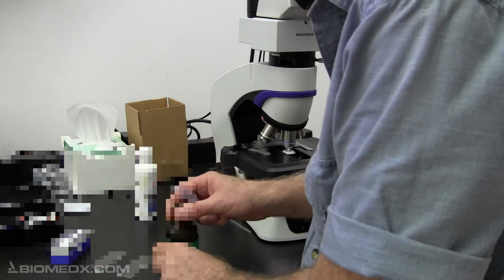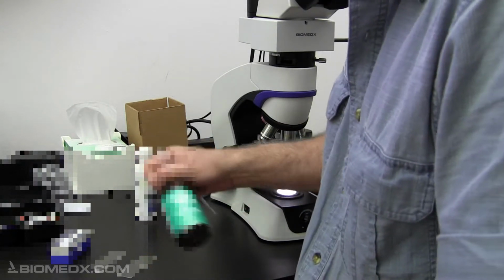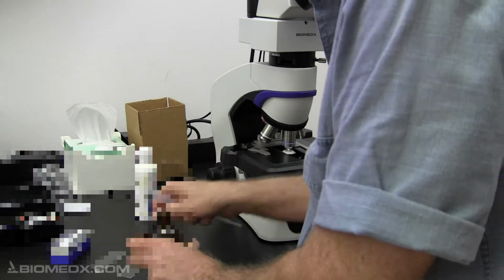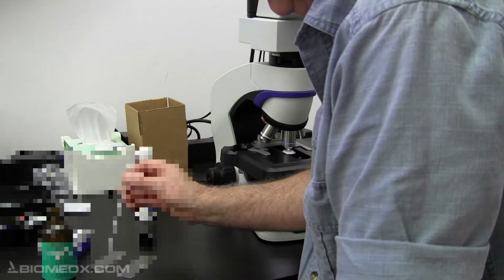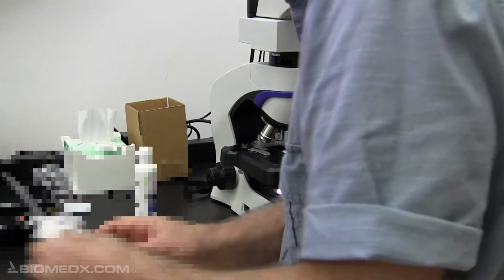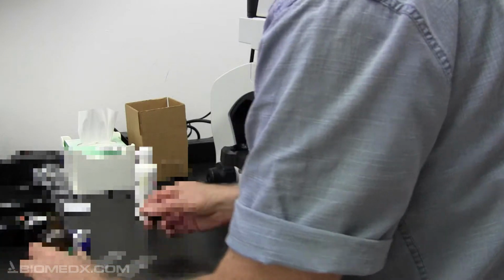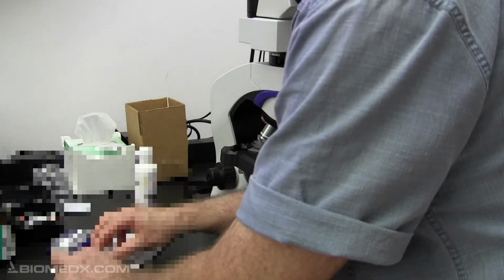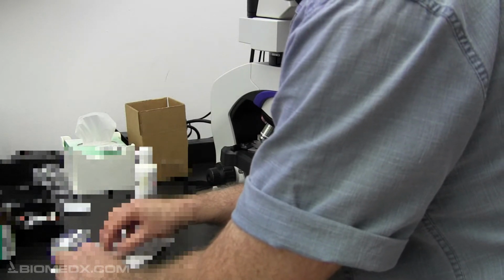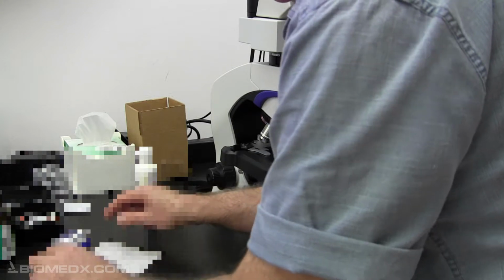Here's your product. I've got two slides set up. I've got the microscope here. I did shake it up. I'll shake it up again. And I'll stick a pipette down in there, and I will get a little bit for a sample. And I'm going to transfer it to the slide right here. One little drop. I'll put a cover slip on that. That's pretty thick, so it's going to go all the way out to the edges of the cover slip. So I'll take a Kim wipe and I'll just lay it on the slide and I'll just touch the edge of the cover slip to get that liquid material so it's not dripping out.